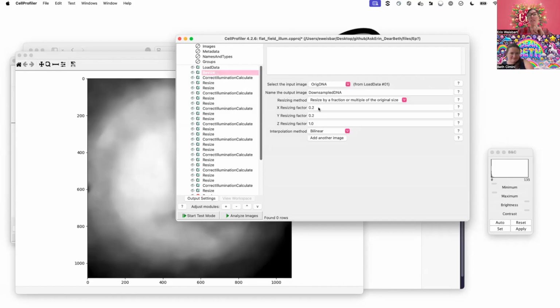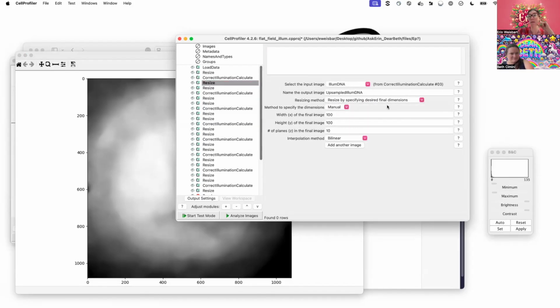If you have an odd number of pixels in one of your X or Y dimensions, and you scale it down and back up again, you may end up with your final Illum image that is not the exact same pixel size as your original image. So that is something where you might need to, rather than resizing by a fraction, resize it to specific dimensions and input the actual X and Y dimensions for your input image.